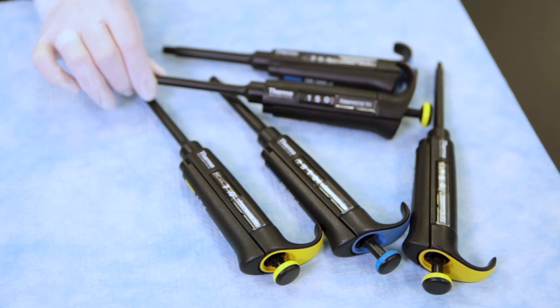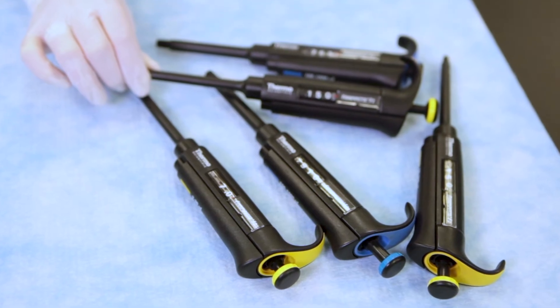Hi, I'm Ben Benson from the Sanford Promise Community Lab at Sanford Research. I'm here to share with you tips on the proper use of a micropipette. This piece of equipment is commonly used in the Biomedical Science Research Lab, and we want to make sure you can use it with confidence.